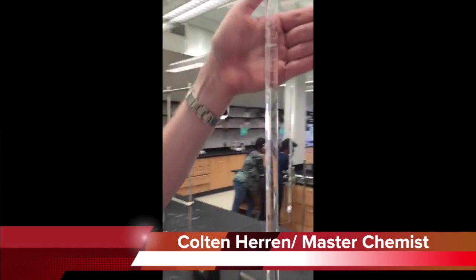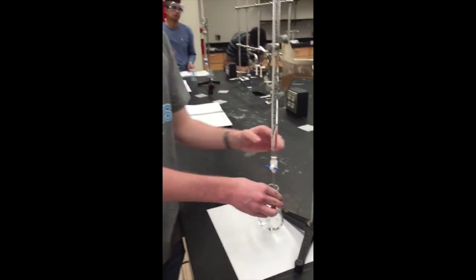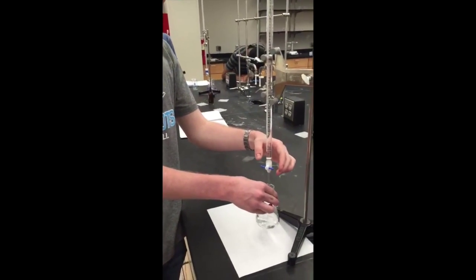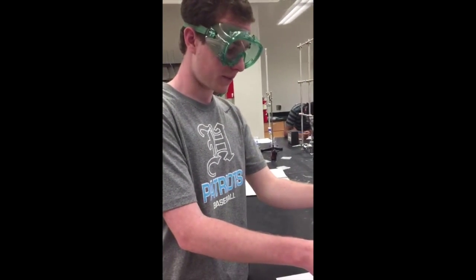Okay, so to begin the titration, we read the initial volume at the bottom of the meniscus, and we see that it is 1.85. After that, we're going to start swirling the solution and adding the NaOH into it until we see sort of a pinkish tint.